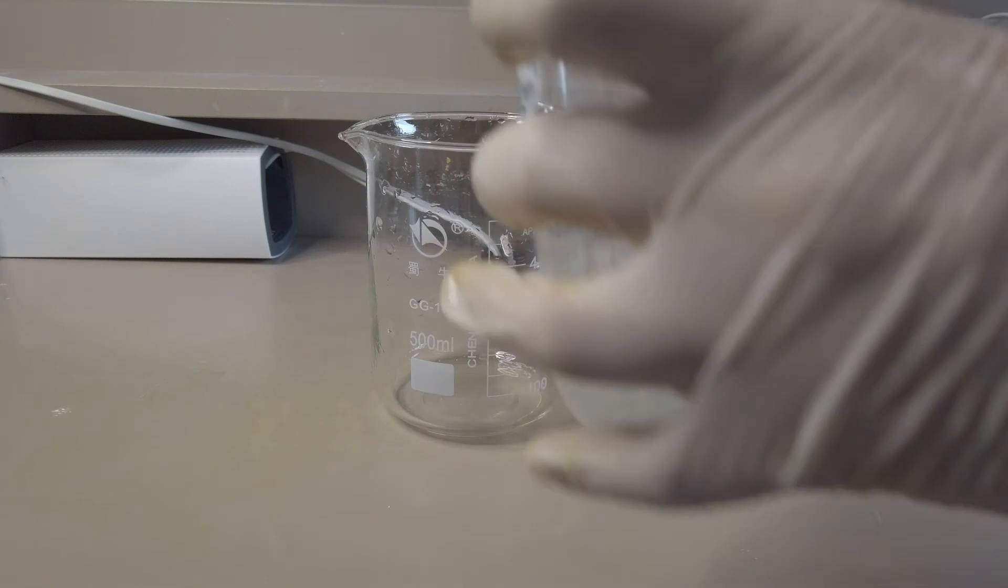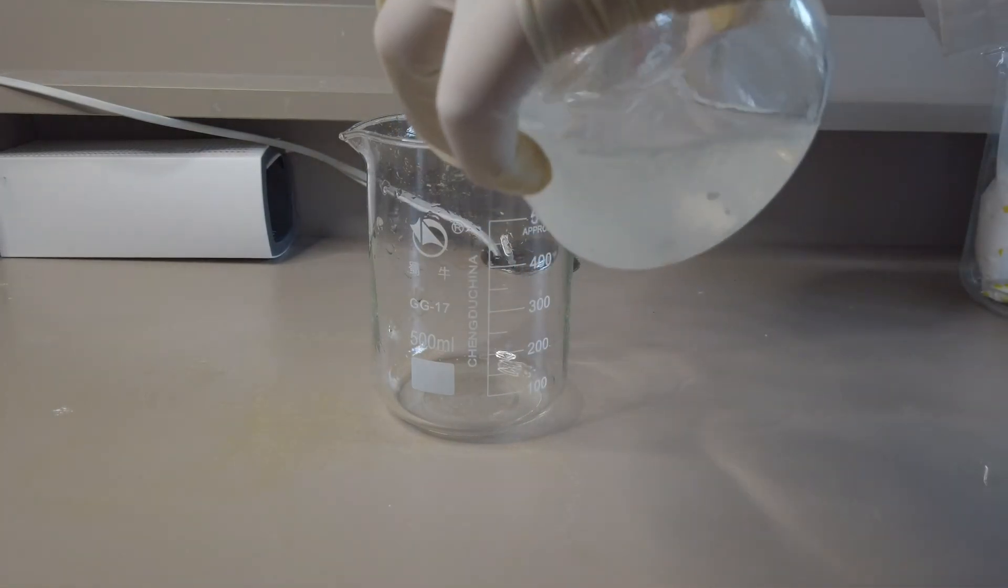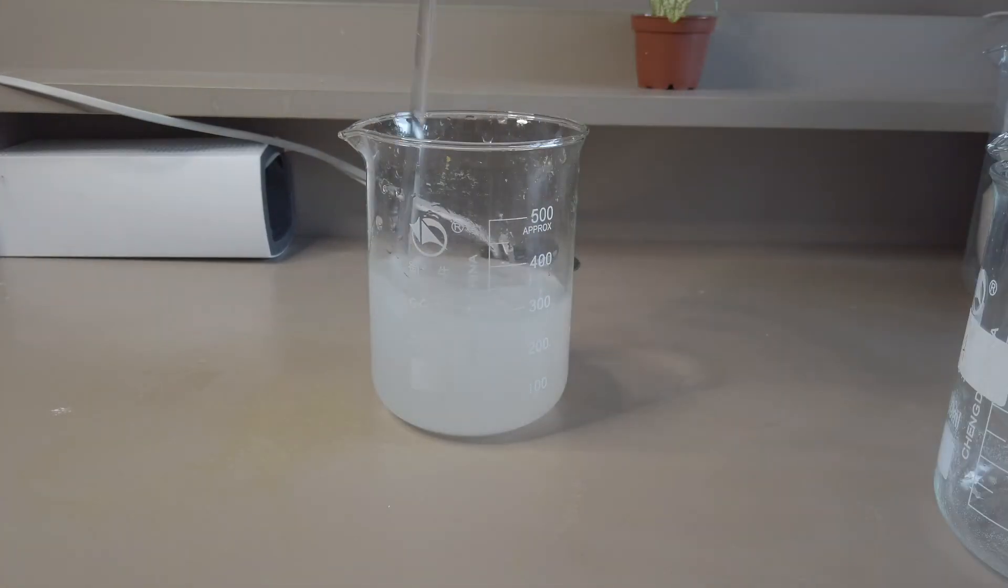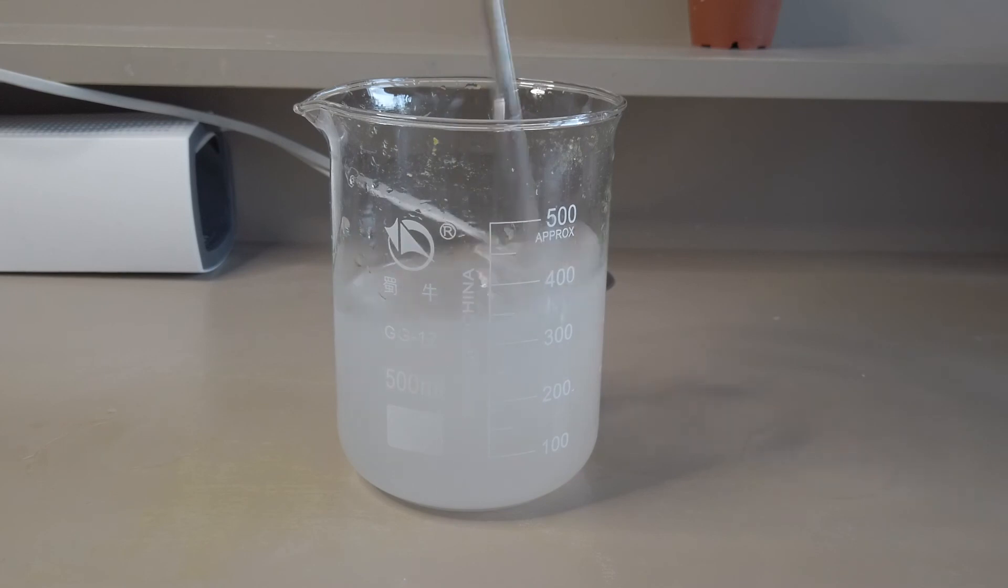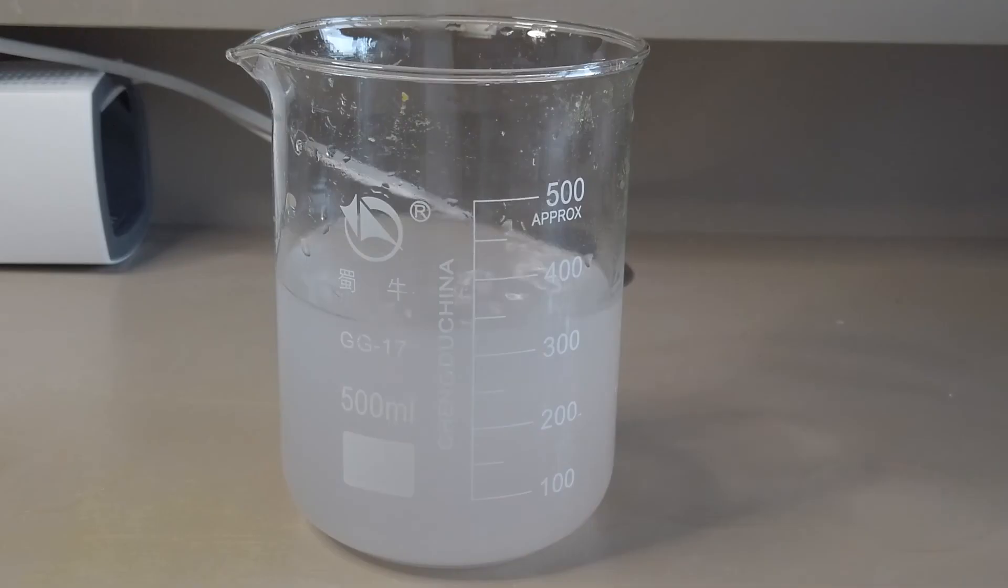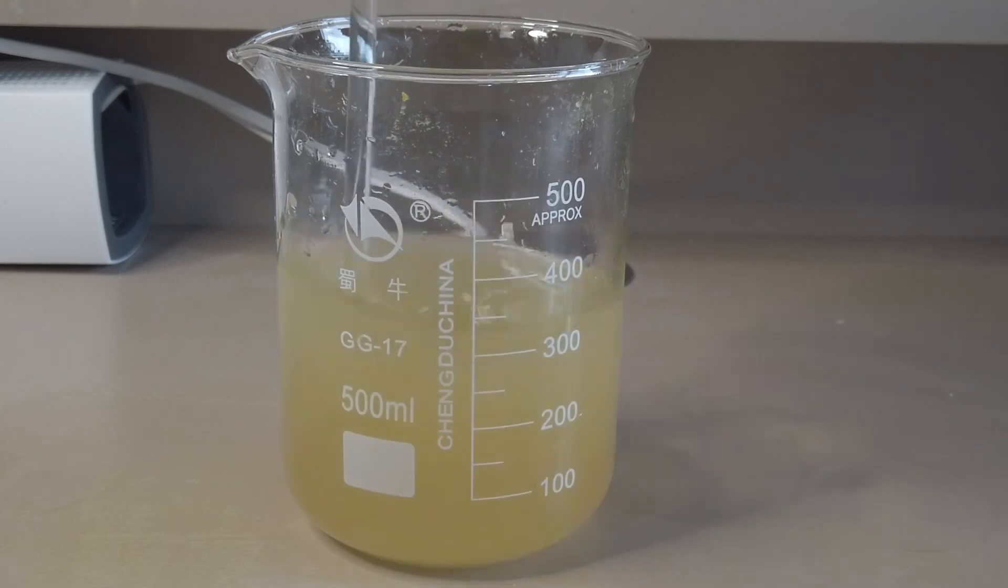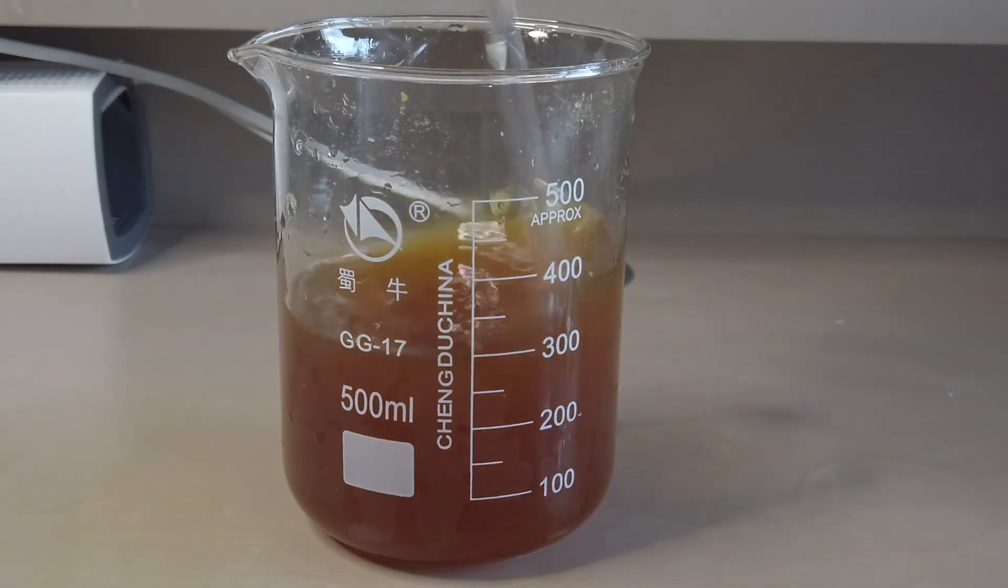The solutions in the two beakers were mixed together at once. And we kept on stirring it. A lot of chemical reactions were happening all at the same time. And when the certain species of reaction has run its course, the colored species will take over the reaction. Thus creating the delayed reaction.